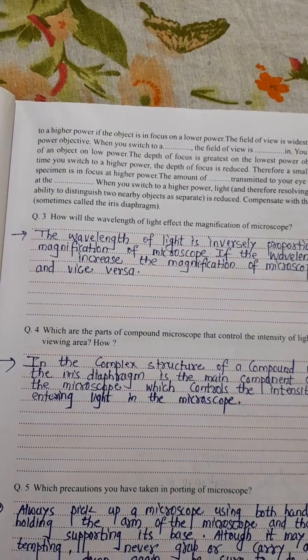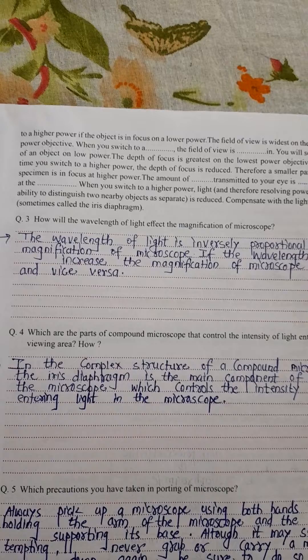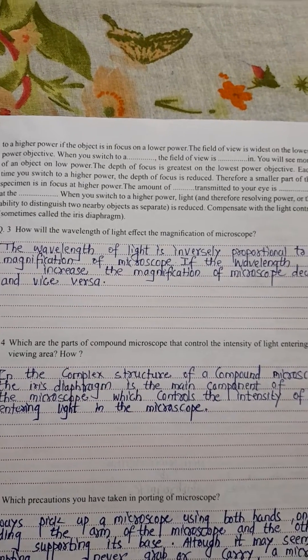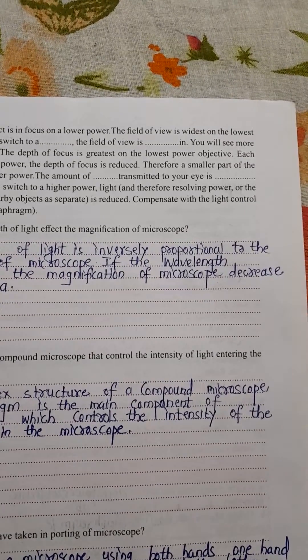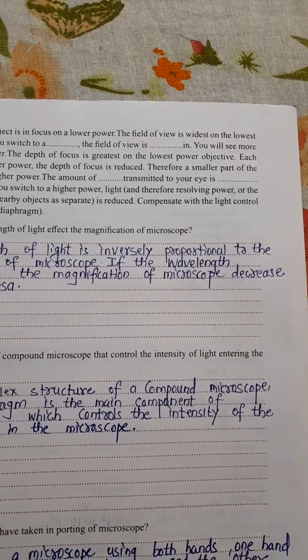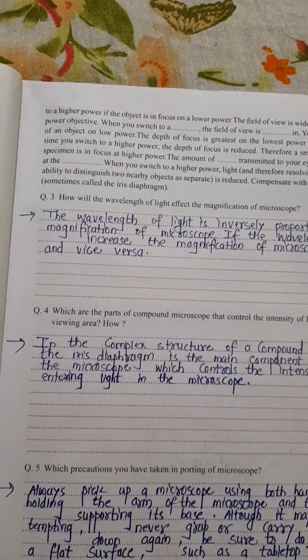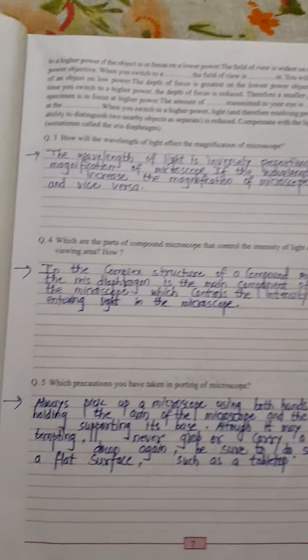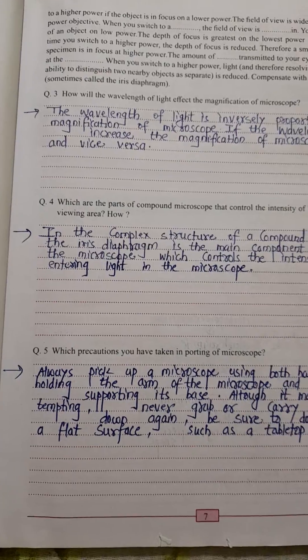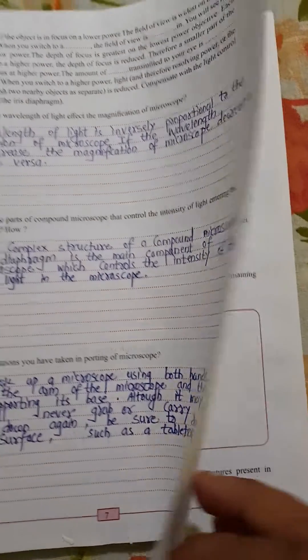Question number three: how will the wavelength of light affect the magnification of a microscope? The answer is given here. And question number five is answered here as well.